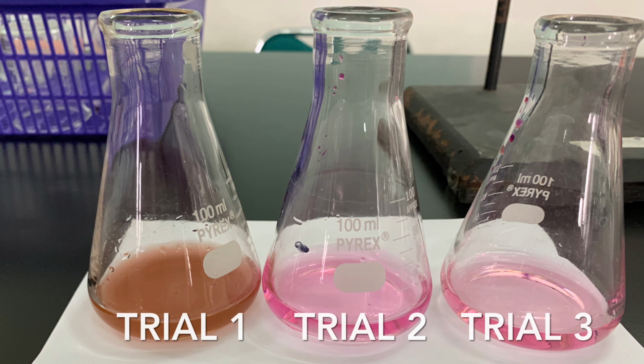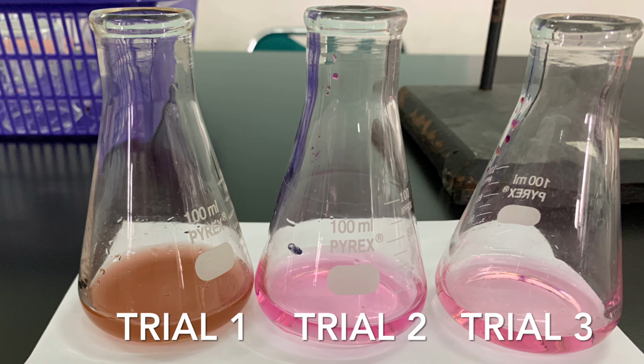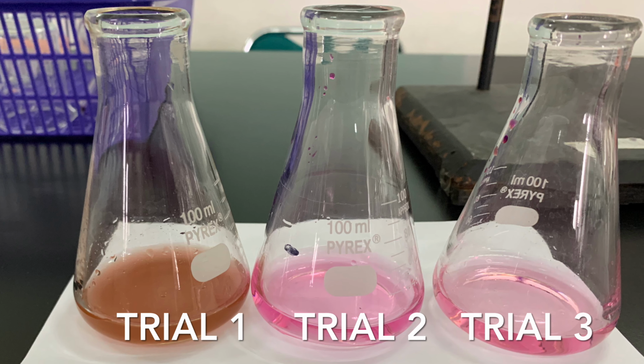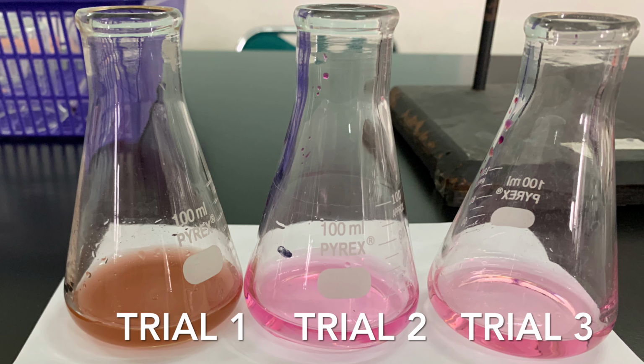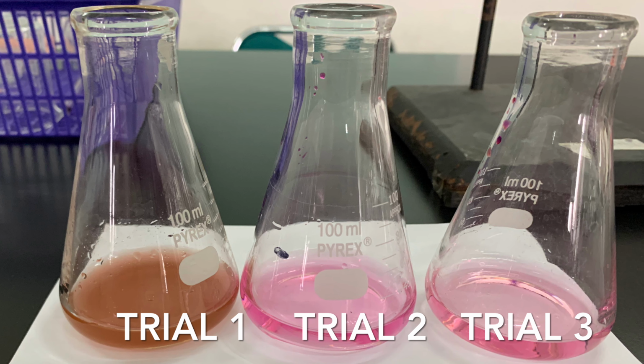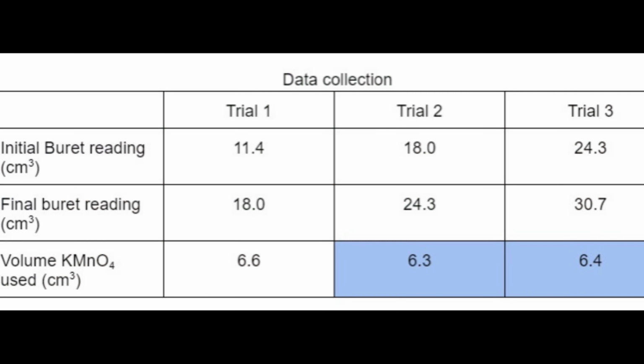This picture shows you the color of the titrate for all of the 3 trials. Remember, in IA, not only quantitative data but qualitative data is also important. This table shows you the raw data collection. 2 accurate data will be used for the calculations.